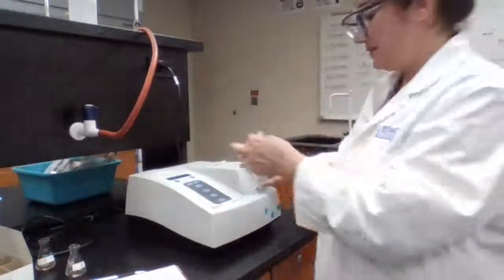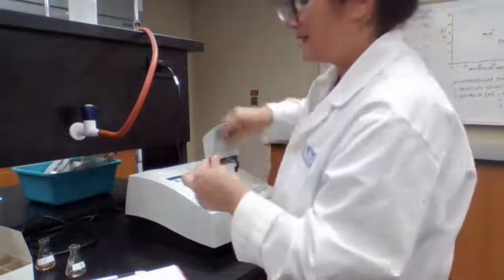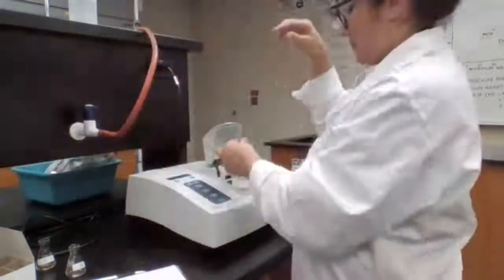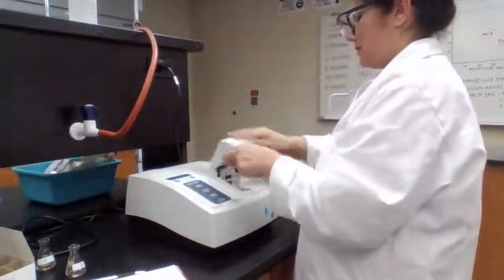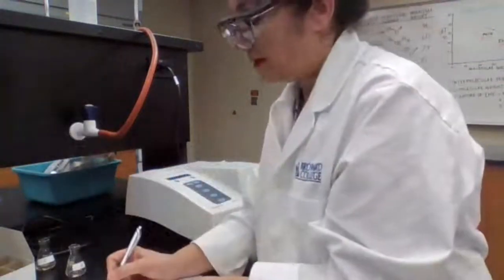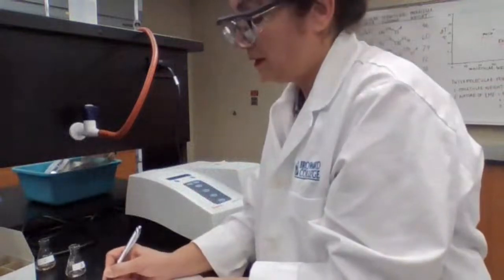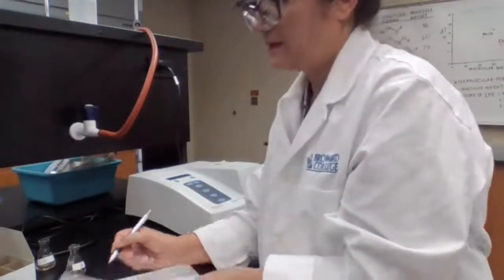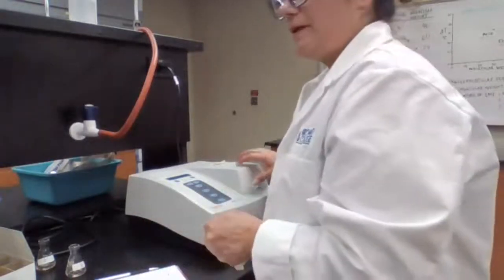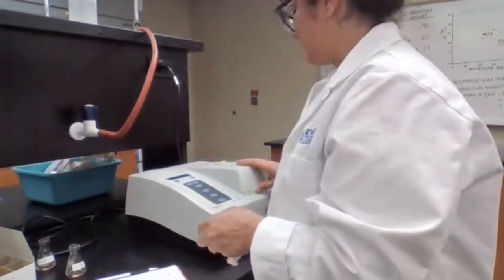Okay, it's 2:07, so I can read my next sample. 2:07. B is 77.3%. 77.3%.